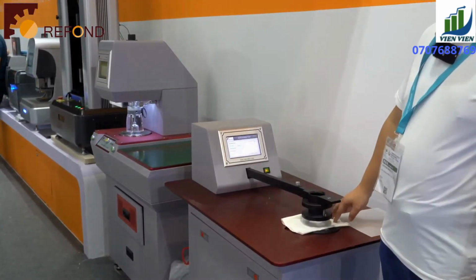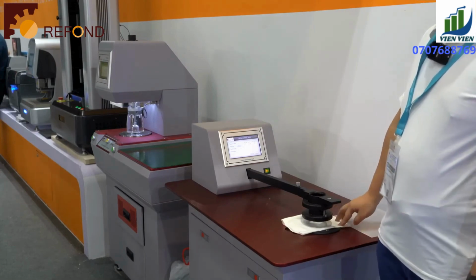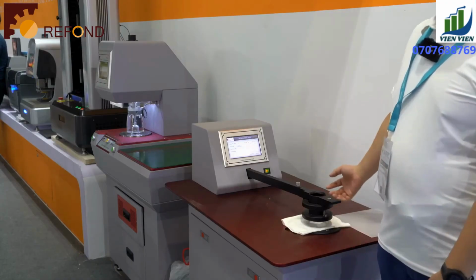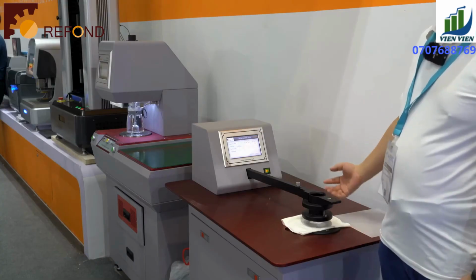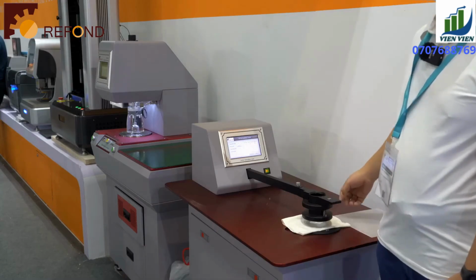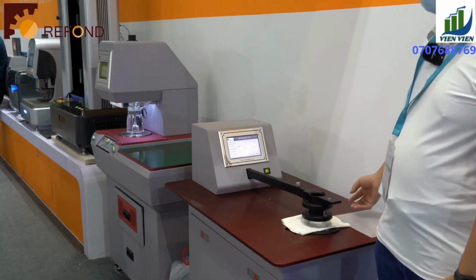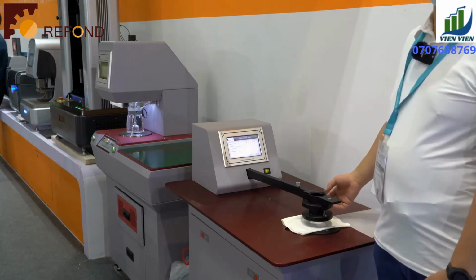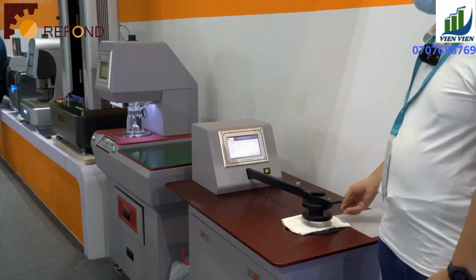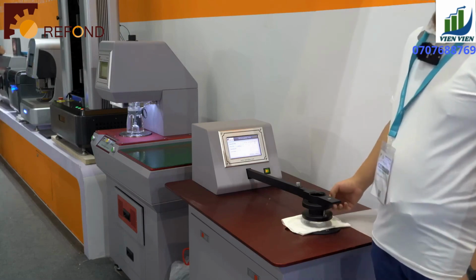The most important innovation for our new machine is that you can use an external calibrated airflow sensor or an airflow meter to calibrate the airflow for this machine. This produces better traceability than the traditional method of calibrating. The traditional method requires different sets of plates, which is labor intensive, and also it cannot provide a lot of traceability. Now we can use flow rate meters to calibrate this machine.